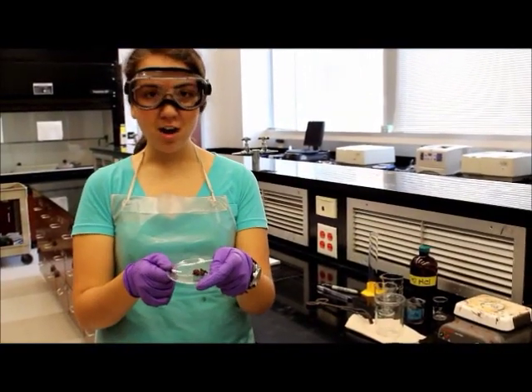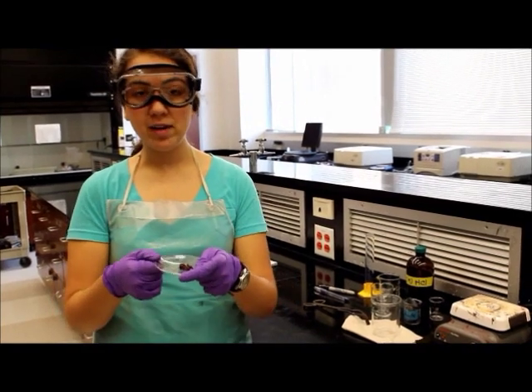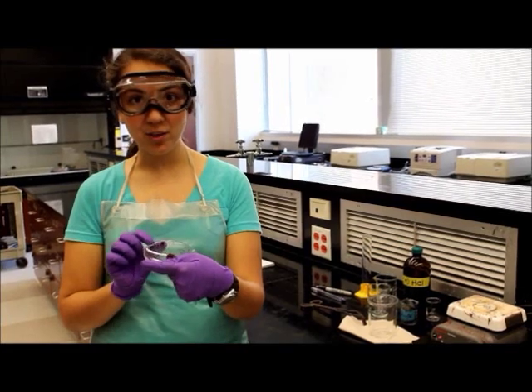Here we have a washed and prepared sample of copper precipitate ready for the oven. An important thing to remember is to clearly label your watch glass.